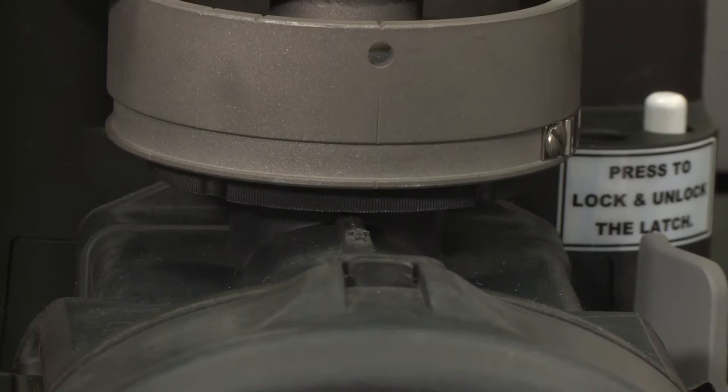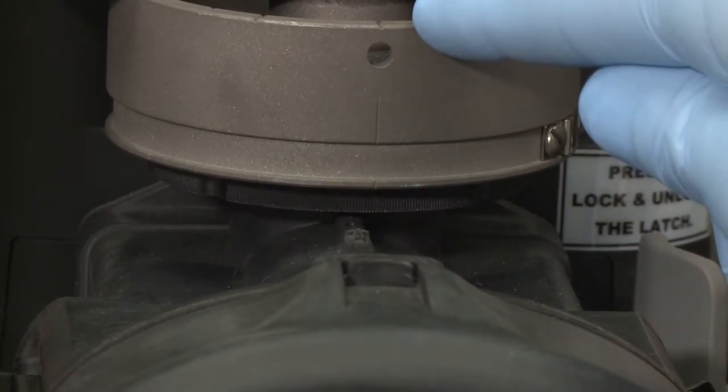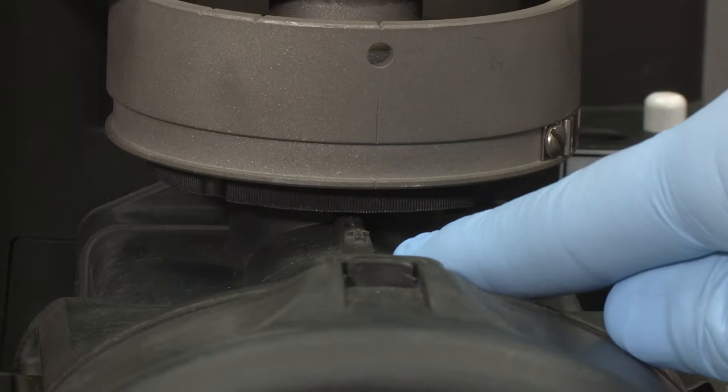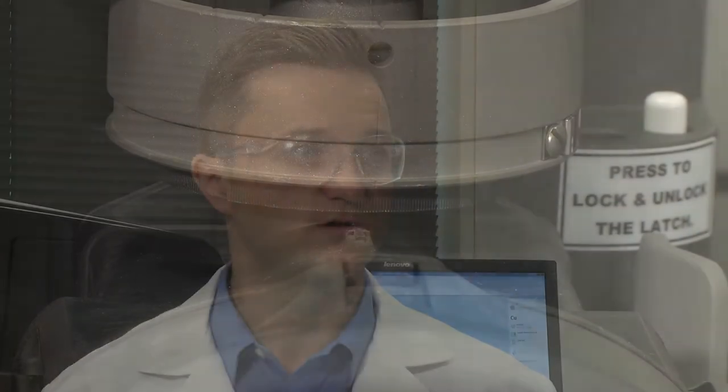For the final step, check the burner alignment. The notch on the front of the burner should align with the notch on the front of the burner chamber. Readjust the burner every time the burner head is replaced.